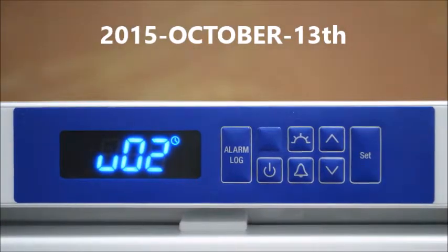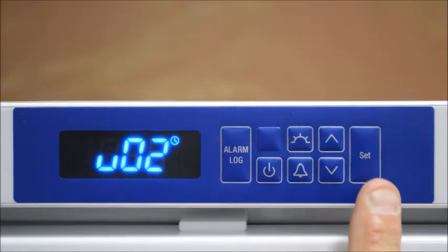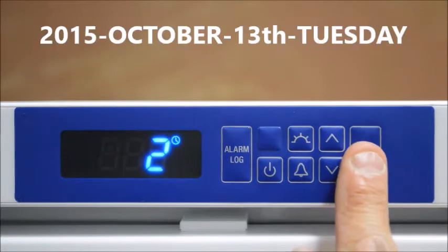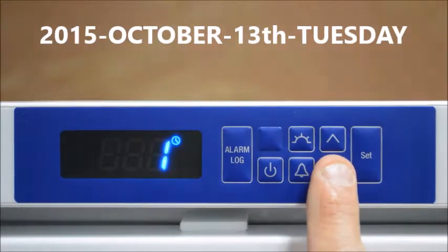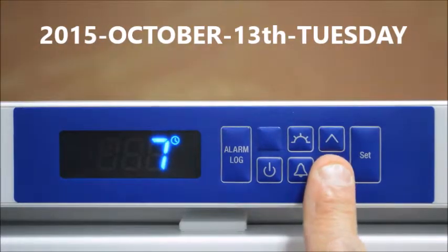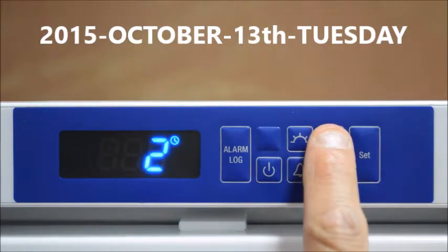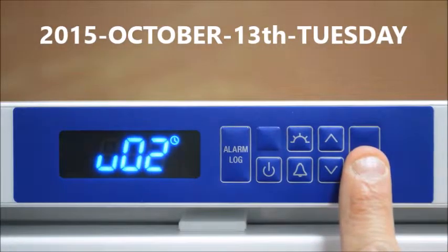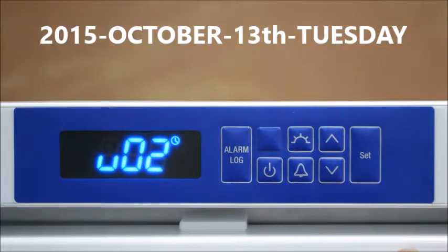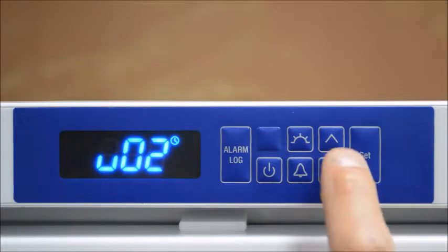By pressing the up arrow we can now change the day of the week. Press SET and scroll up and down, with one being Monday and seven being Sunday. Pressing the SET button we have now added the day of the week.